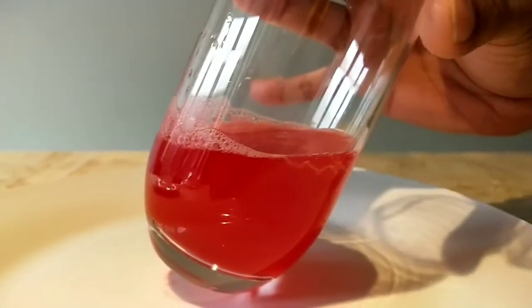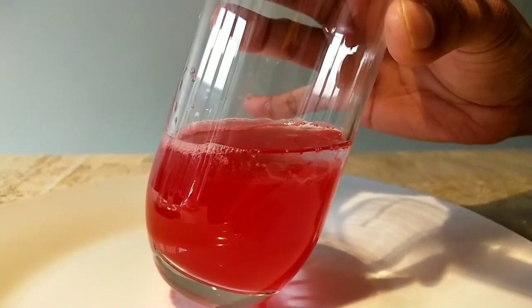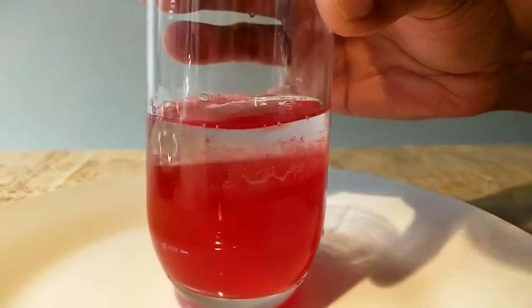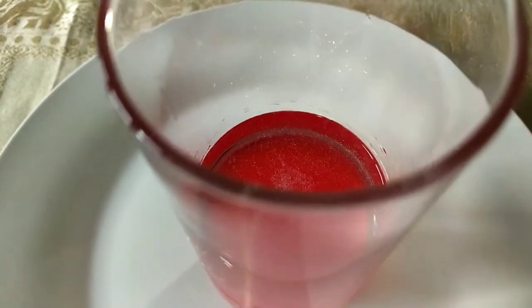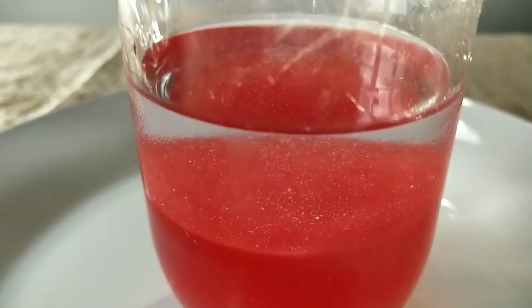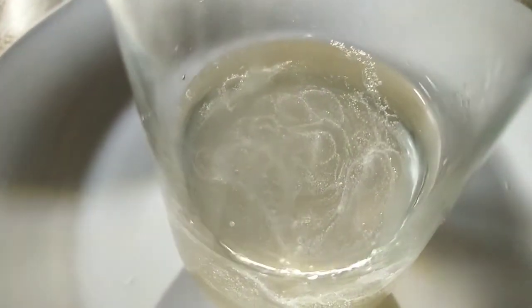Now let's try with the strawberry extract. Put it in and see what happens. Make sure the alcohol is cold. Sometimes you've got to wait for a while. It's also starting to form in Anoush's cup — can you see they're starting to come up? These are clumps of DNA strands of strawberry. Now let's see the banana. Can you see how many have started to come up? Those are all the strands of DNA that have begun to clump.